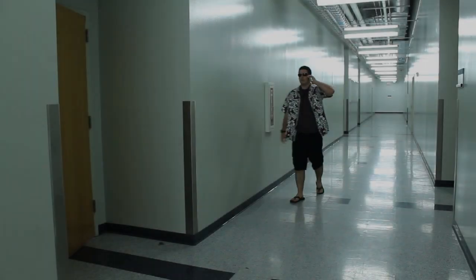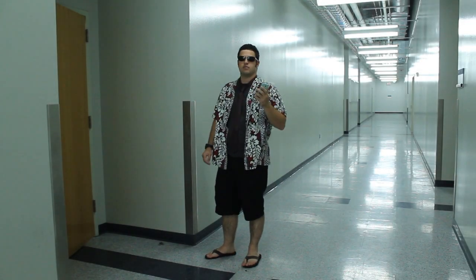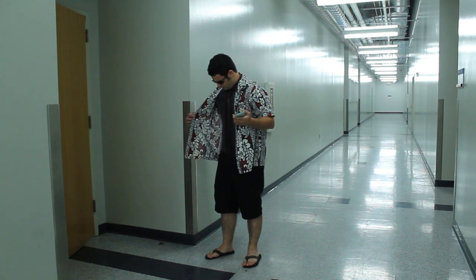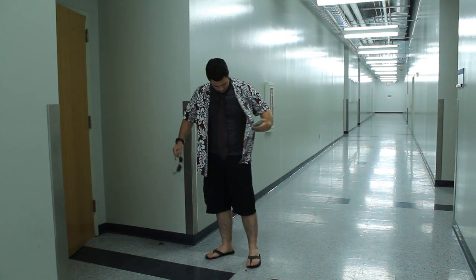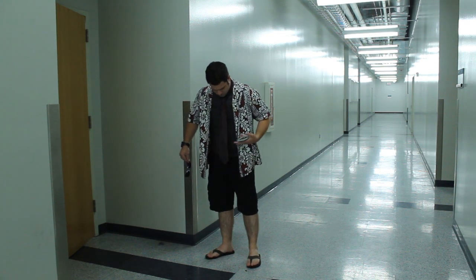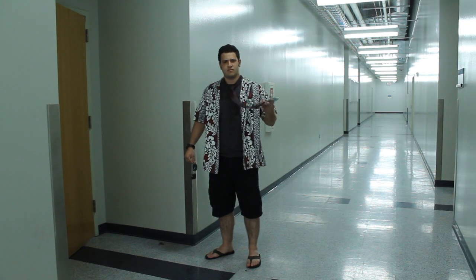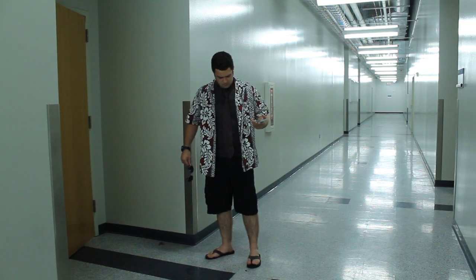Oh, here comes the new student I've been expecting. Hey, you haven't read the lab manual, have you? I can tell. Your clothes are all wrong. Your shirt is unbuttoned and way too baggy. Your shorts don't protect your legs completely. Your necktie could get caught in machinery, and you're not wearing closed-toed shoes.